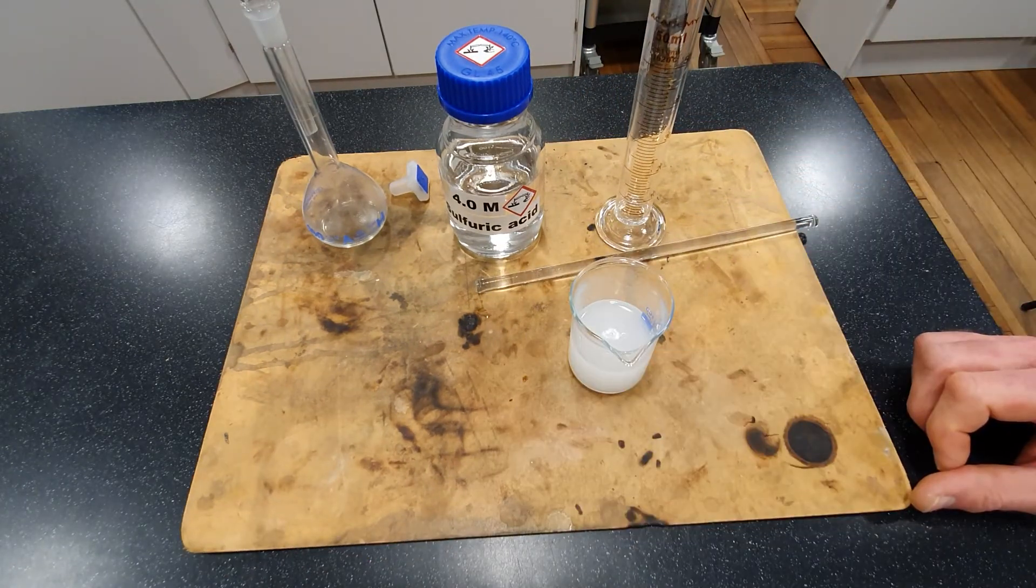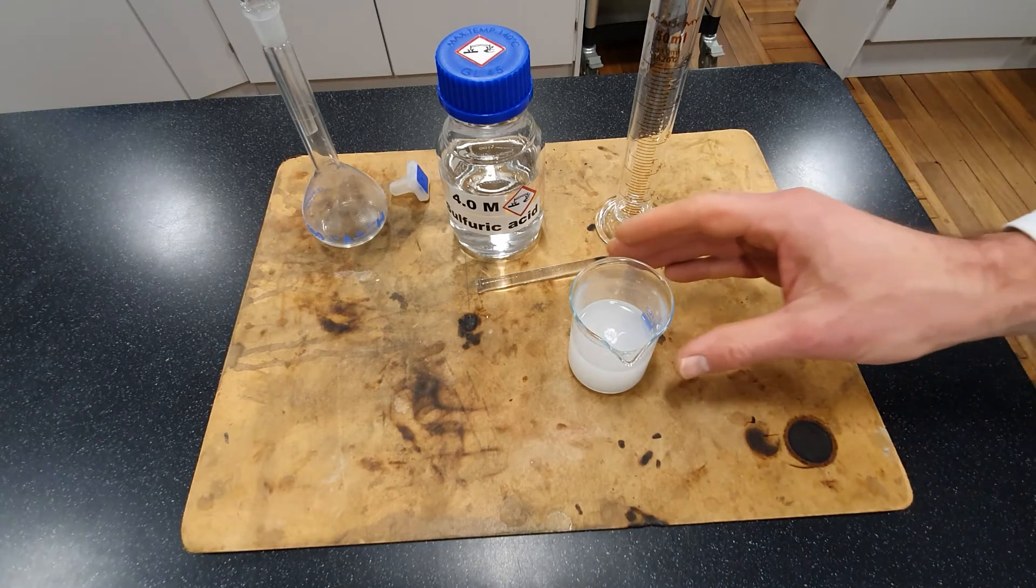Filter the solution to remove any undissolved solids into the volumetric flask.